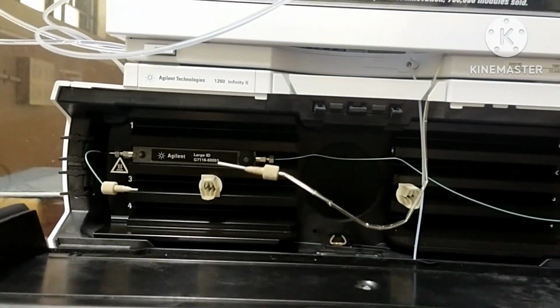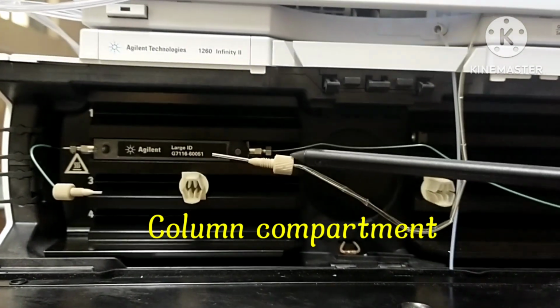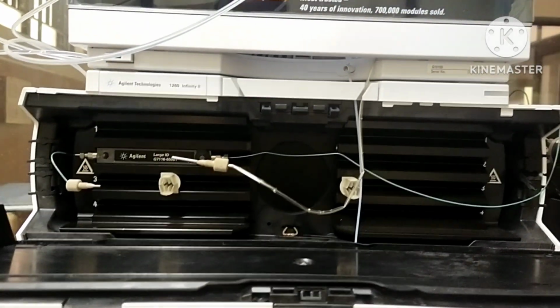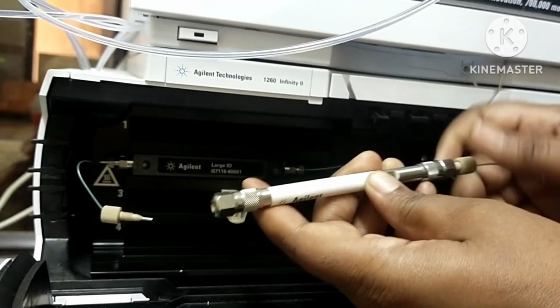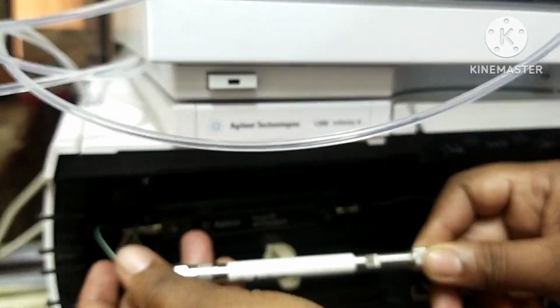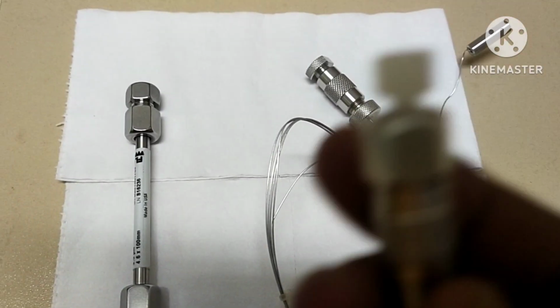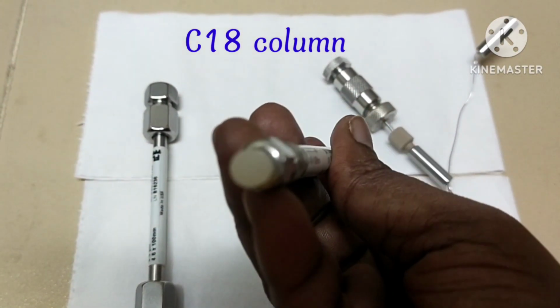This is the thermostated column compartment. This temperature controlled column compartment is used for heating and cooling in order to meet the extreme requirements of retention time reproducibility. Separation of sample is performed inside the column. Stainless steel columns are most commonly used. The packing material generally used is silica or polymer gels. It is a C18 column, probably the most popular type of column for HPLC.